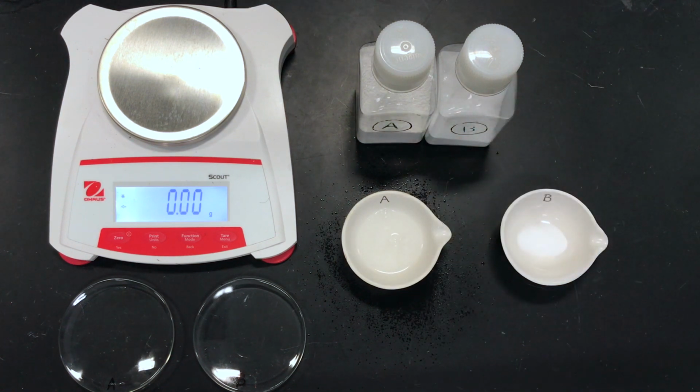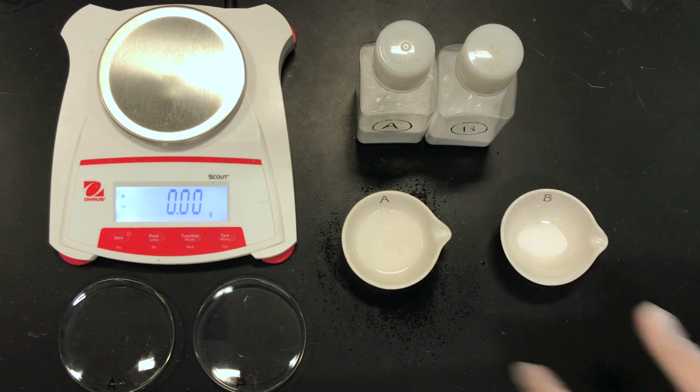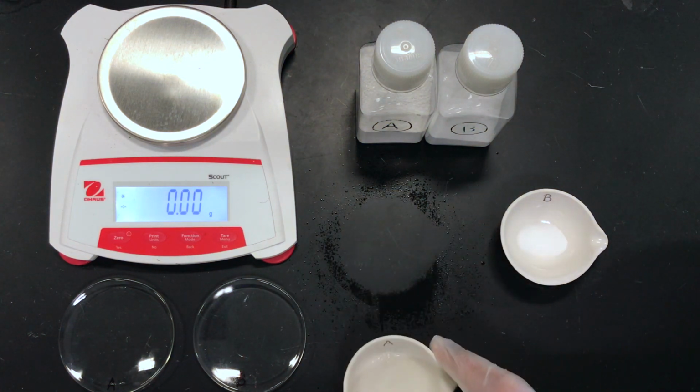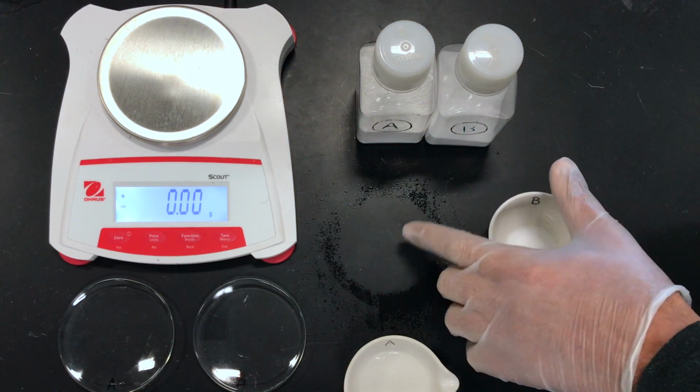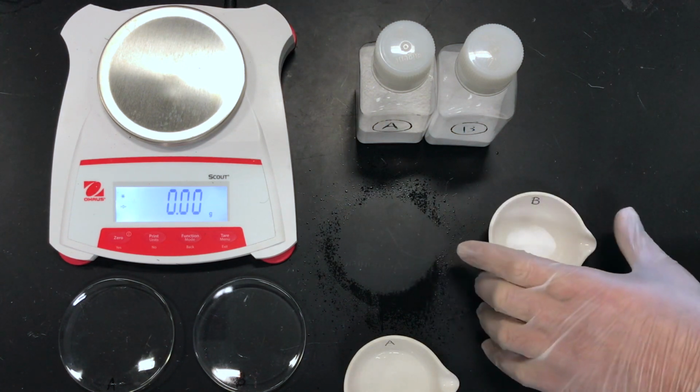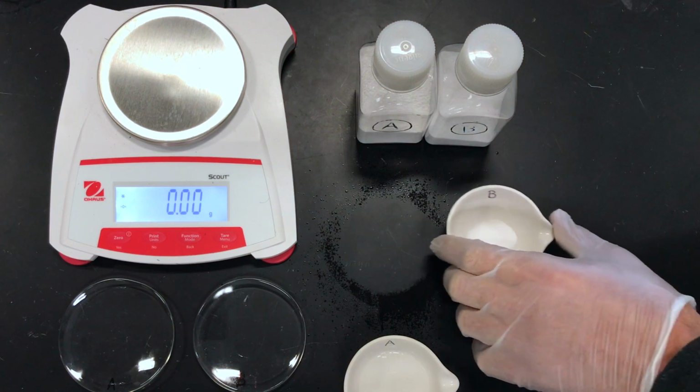And there's no more visible bubbling. There's a little bit of bubbling, but I don't see any solid in the bottom of that. Okay, let's do chemical test B. And as you can see, there is some fizzing that occurred, so there might be some loss of sodium chloride.